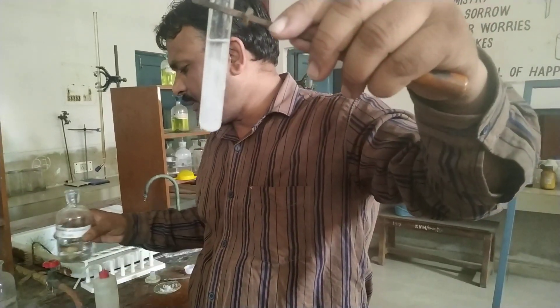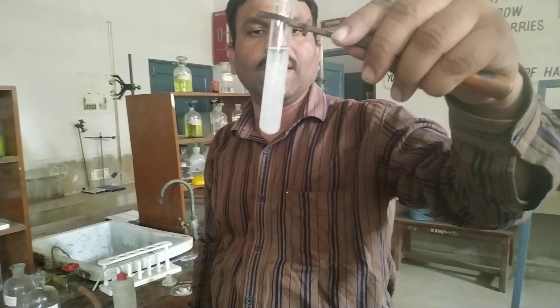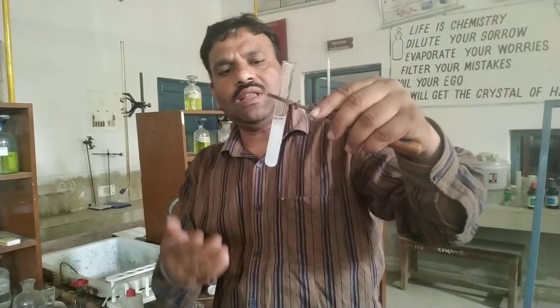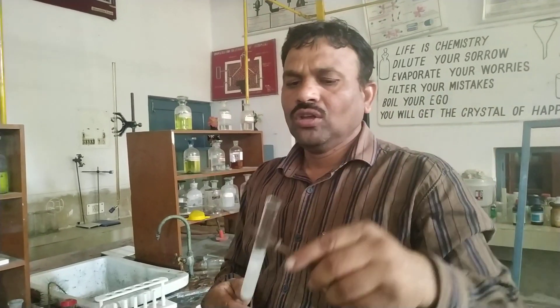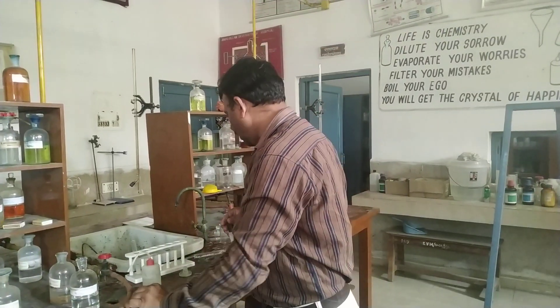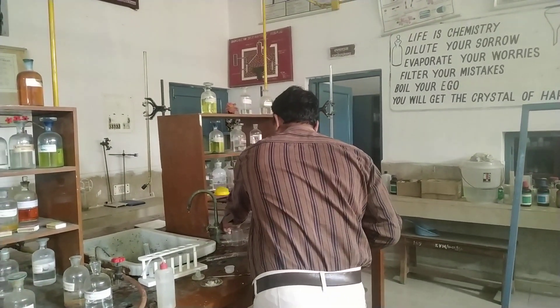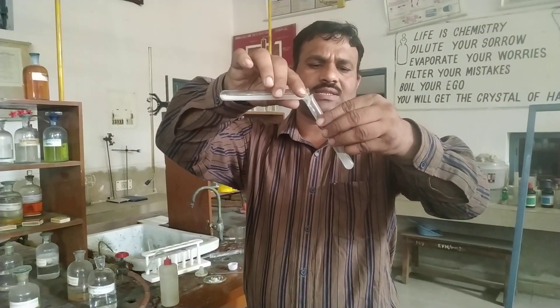On addition of dilute hydrochloric acid, we are getting a white precipitate in the test tube. This white precipitate indicates the presence of group 1 or lead. To confirm whether the precipitate is of lead, we divide the solution into two test tubes because we want to perform two different tests.